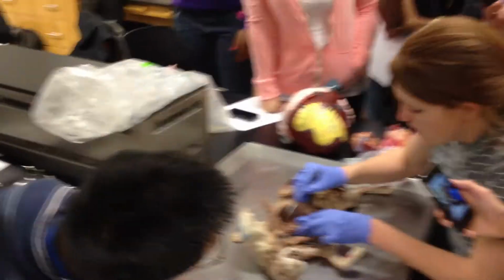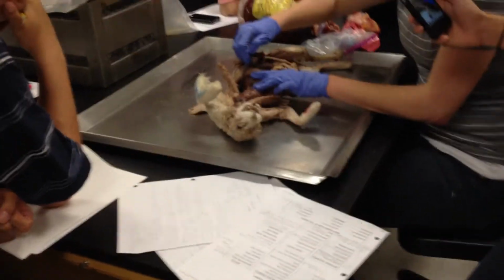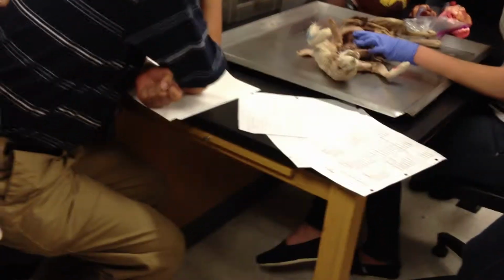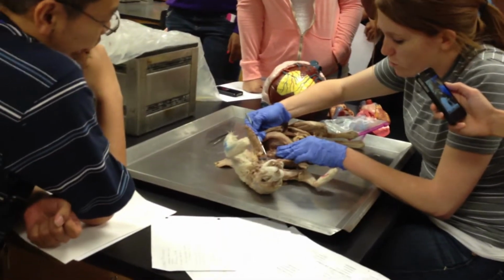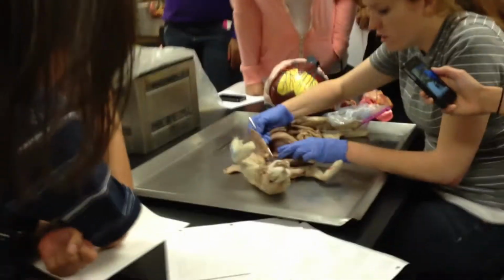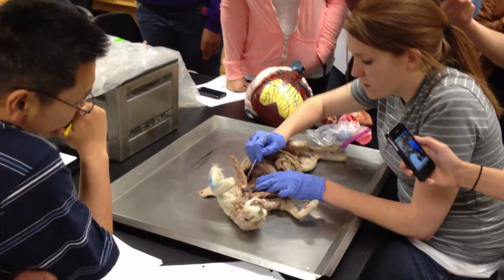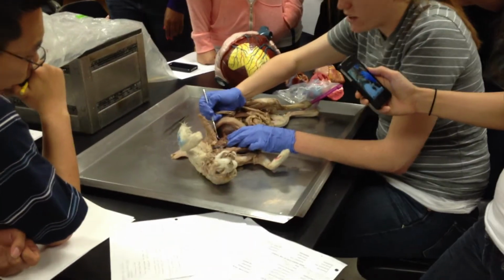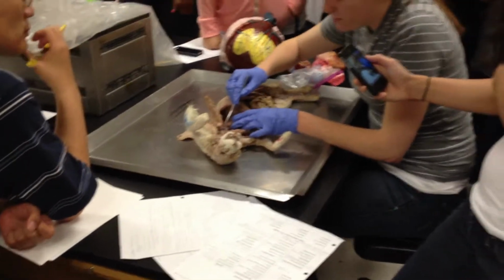The aorta is coming down and around. When it curves down and goes down toward the body, that's when it becomes your dorsal aorta, and it'll run all the way down through your body. But here's my first, well, after the coronary artery, right? Here's my first branch off of it. What's it called? Brachiocephalic trunk. Here's my second one, right? Because this is the cat, they only have two. It's the left subclavian.